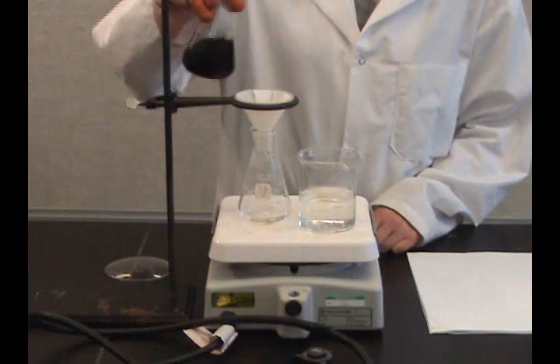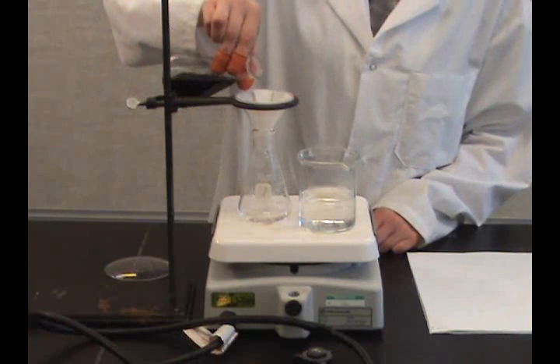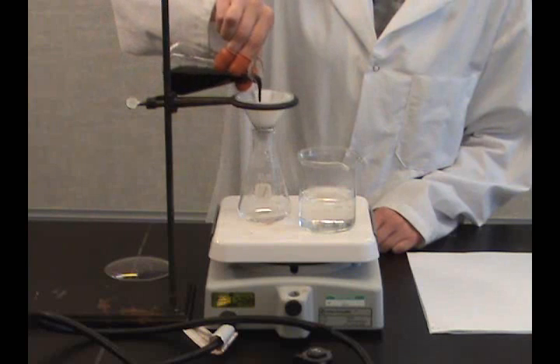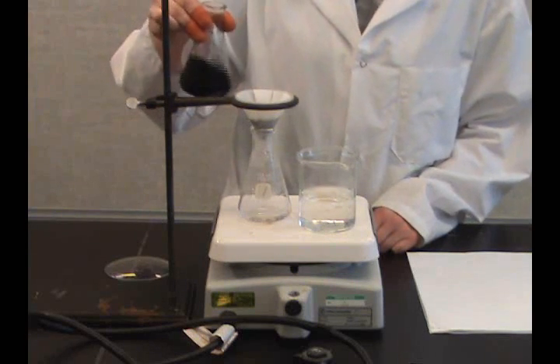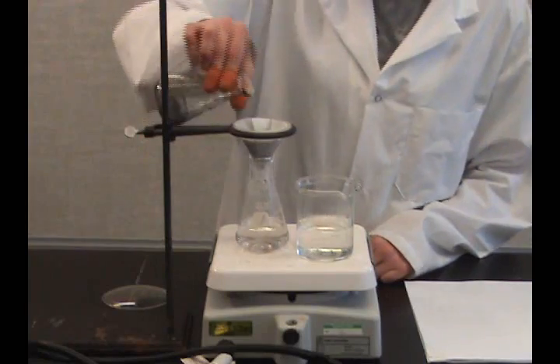To avoid premature crystallization, keep the filtered and unfiltered solutions as hot as possible and pour the solution in small portions into the filter to produce the maximum rate of filtration.